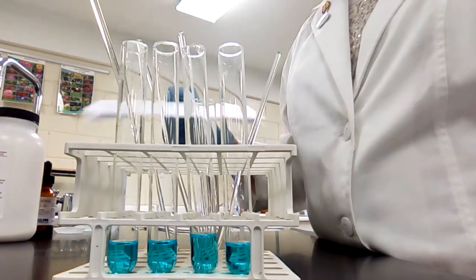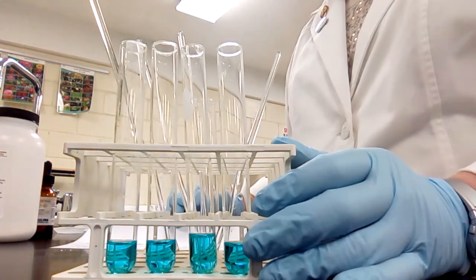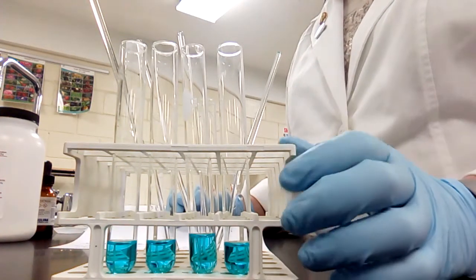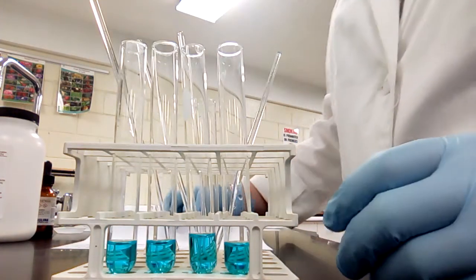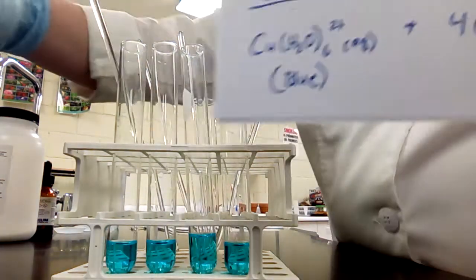Welcome back to AP Chem. Today I wanted to do a little reaction for you. Usually you would do this one with me in the lab yourself, but since you can't and we weren't able to get to it in class today, I wanted to go ahead and record a little video for you. This is the common ion effect.